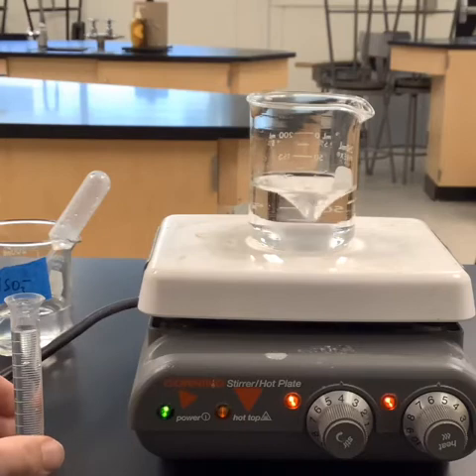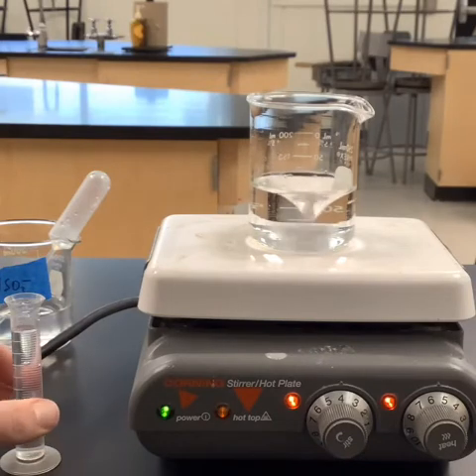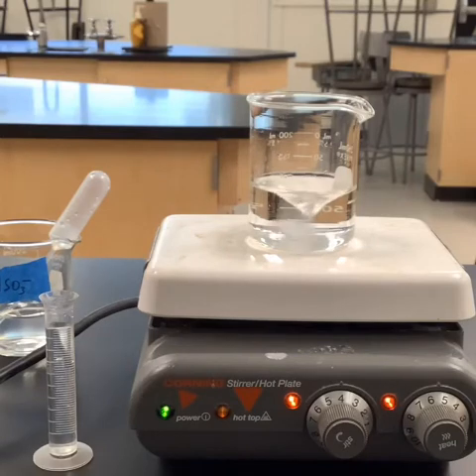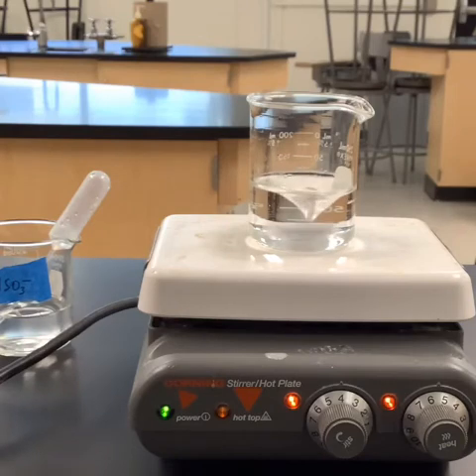You guys are actually lucky you've got a video here. You can always rewind it if you screw up. In class, if you screw up, then you have to redo the lab. So here we go. We're watching for a color change. Remember that the minute our HSO3 runs out, the I2 starts to form and boom, we get a color change. And we know that the HSO3 minus is gone.